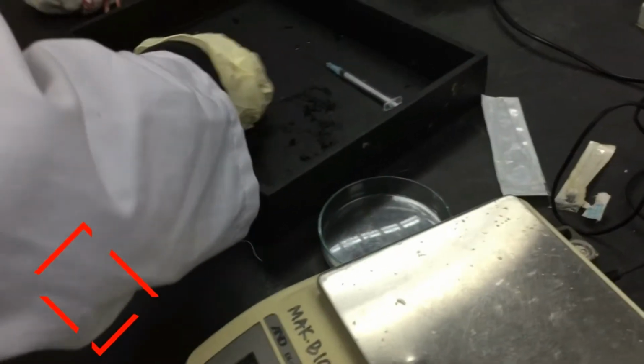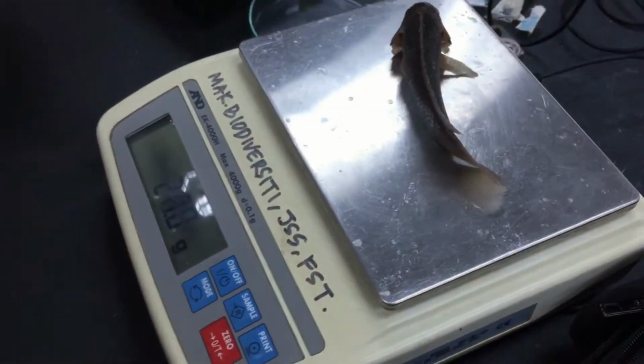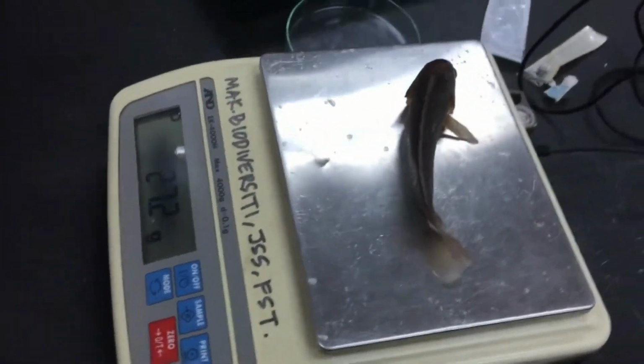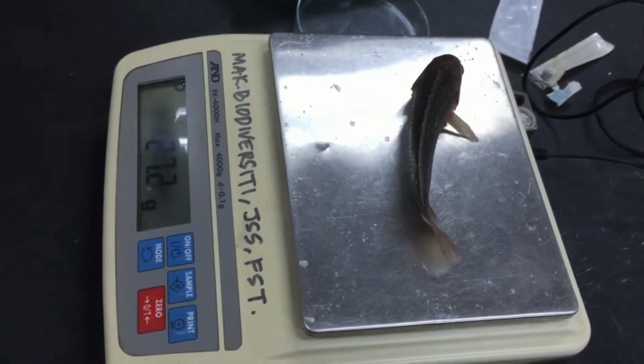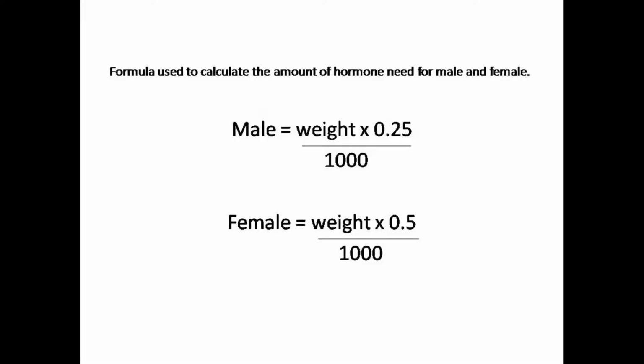Moving on to the methodology part, which consists of obtaining the eggs, preparing the solutions, and observing the egg stage. The freshwater fish, Anabas testudineus, was used in this experiment. The sex of the fish was determined by observing the genital papillae, color, and body shape of the fish. First, weigh the fish using an analytical balance to determine the amount of hormone needed to be injected into the fish. The following formula was used to determine the amount of hormone needed for the fish according to its sex.